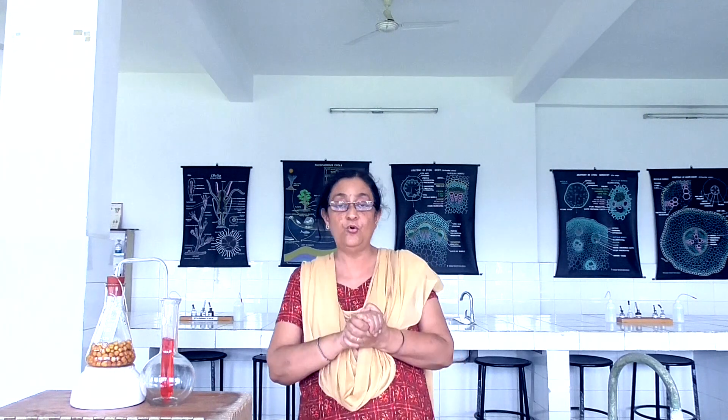Hello children, welcome to BioLab. Today we are going to perform an activity, and in this activity I will tell you how you can prove that carbon dioxide is given out during respiration in plants. So let's begin with our activity.